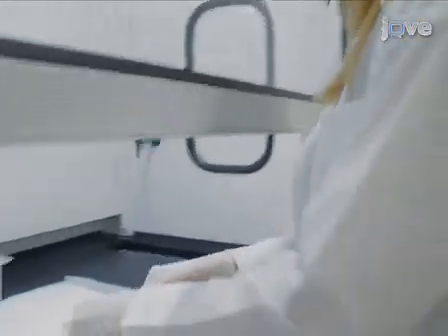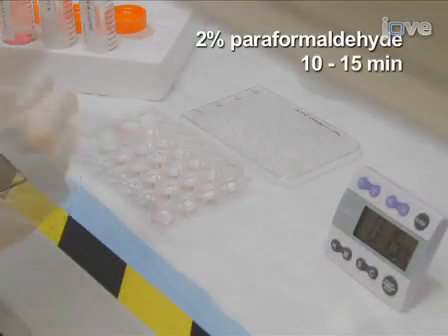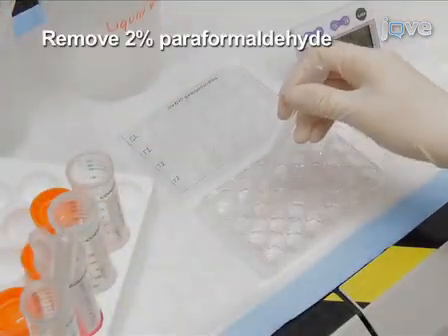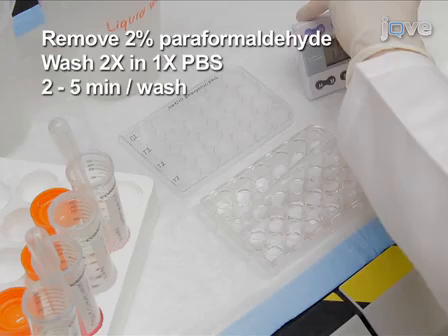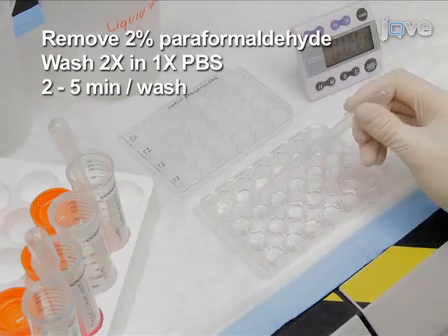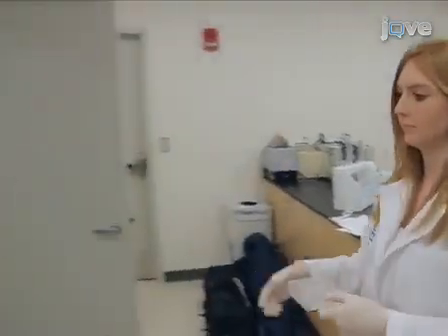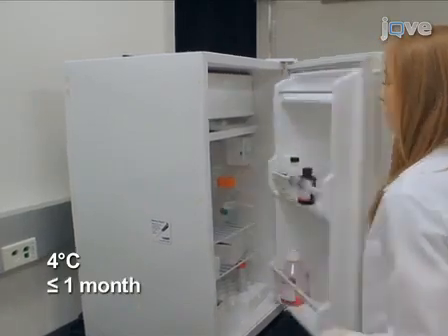In a fume hood, fix the neurons in 2% paraformaldehyde for 10 to 15 minutes at room temperature. Wash twice in 1x PBS for 2 to 5 minutes each wash. The fixed neurons can be stored in fresh 1x PBS at 4 degrees Celsius for up to 1 month.